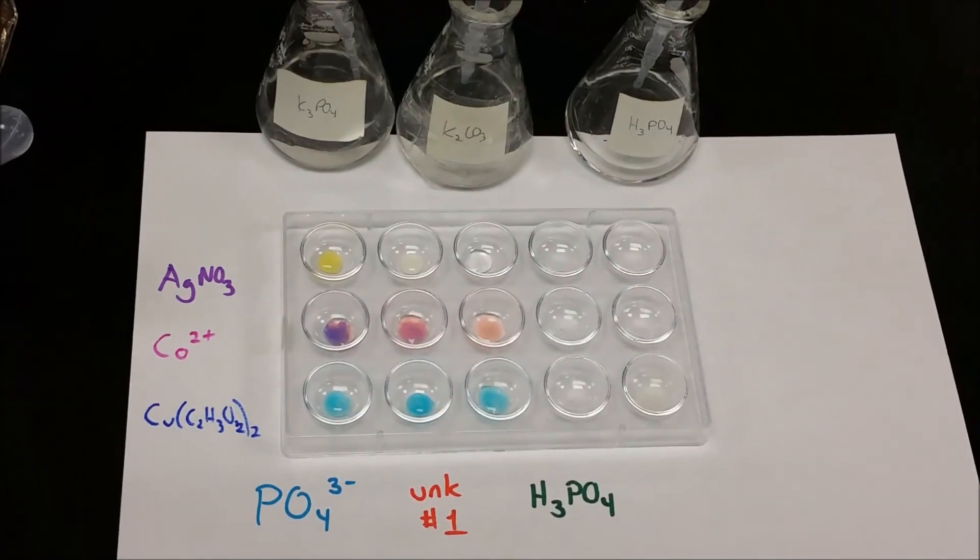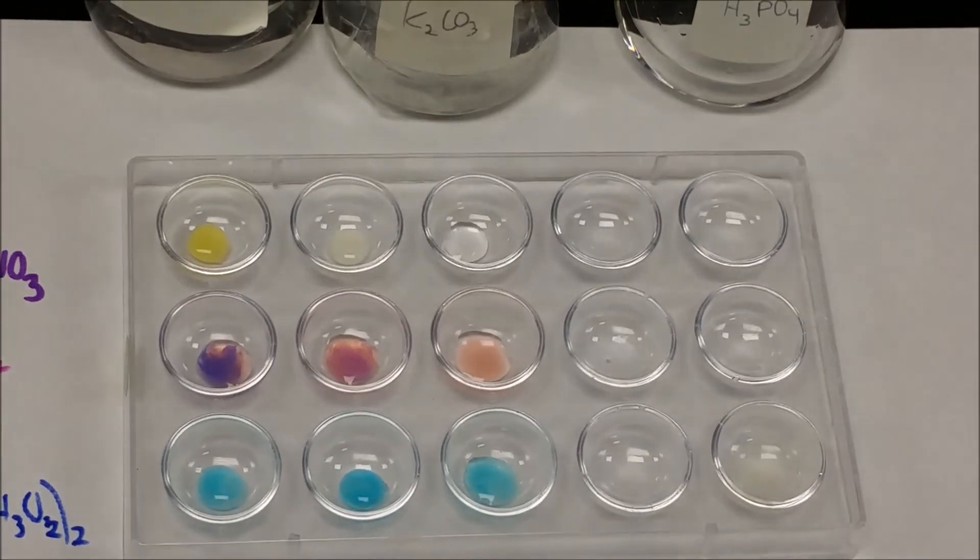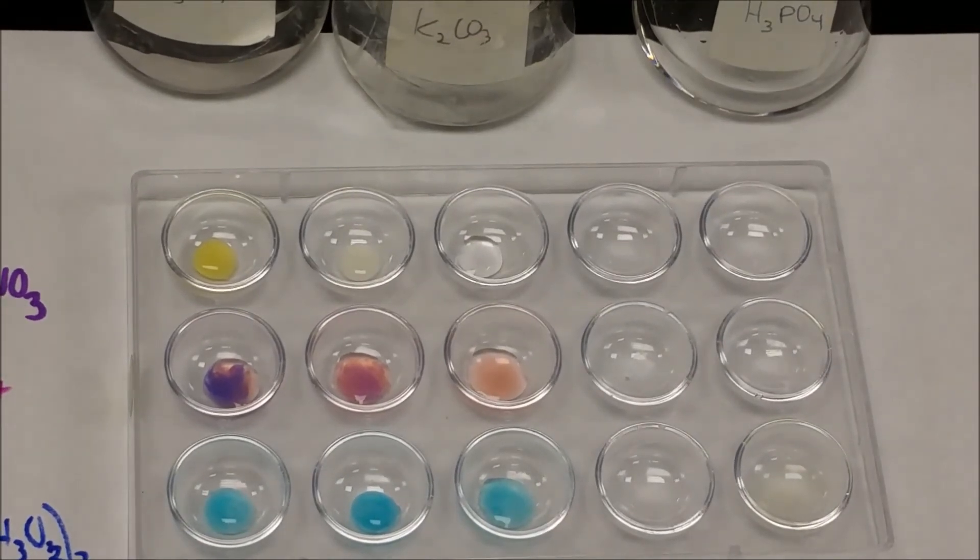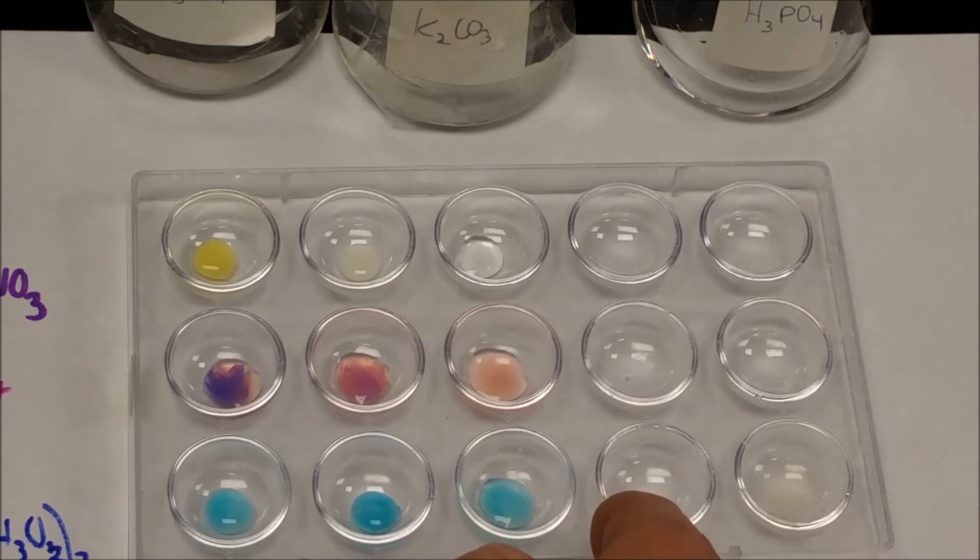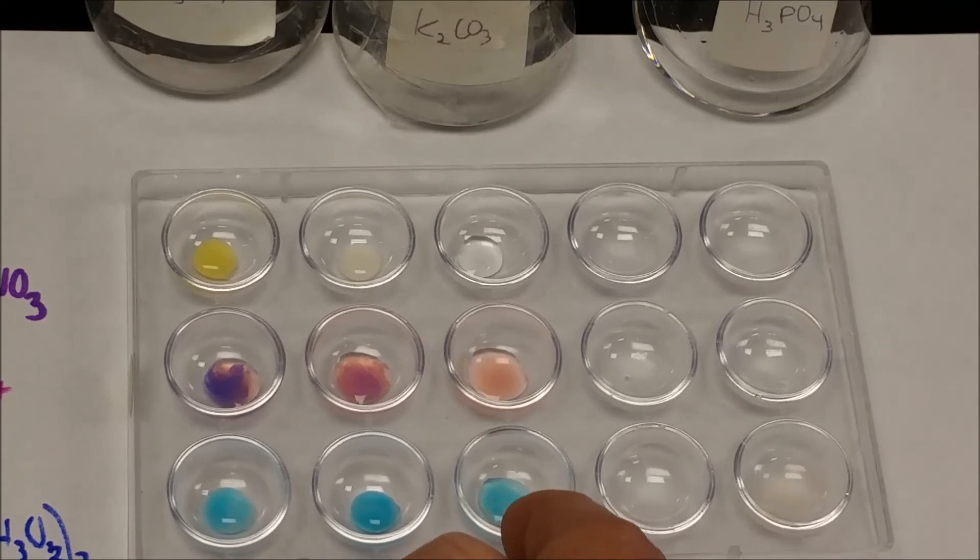Let's zoom in here and see our precipitates. If we had done water or phosphoric acid, the water would have just mixed with the copper(II) acetate solution and no precipitate would have formed.